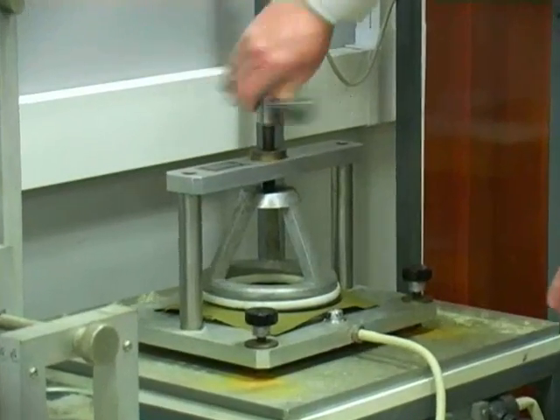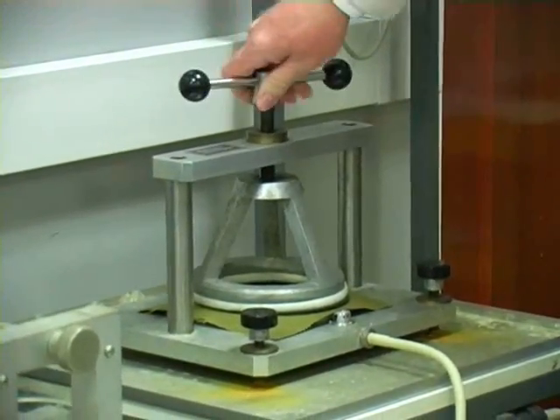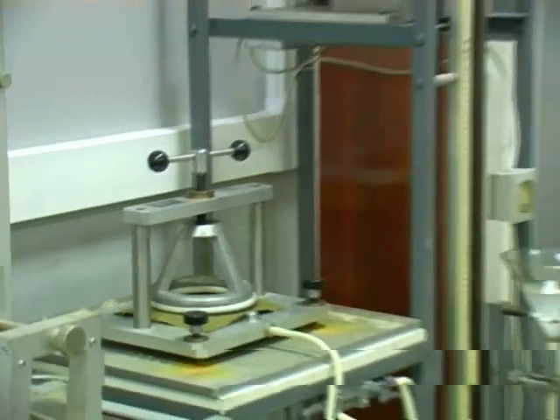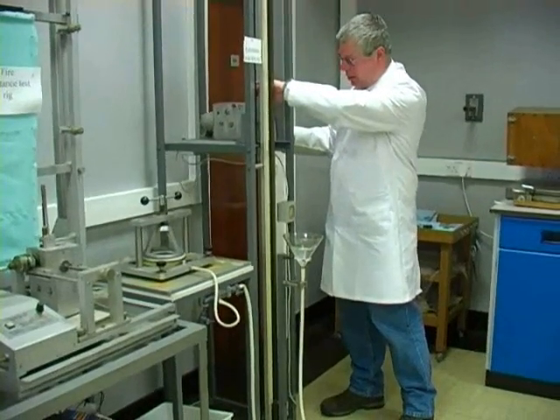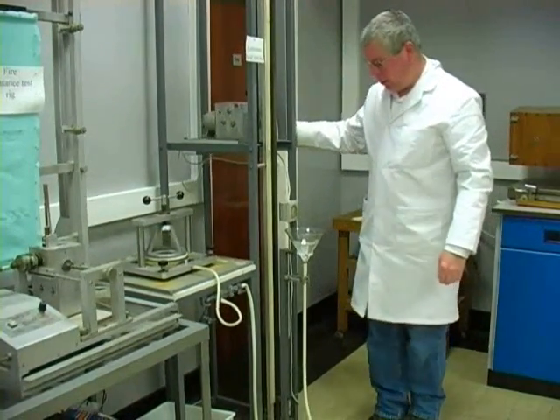Clamp that down nice and tight. Switch on the motor and knock it into gear.